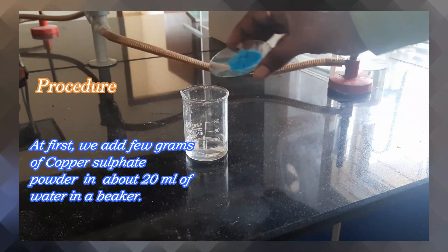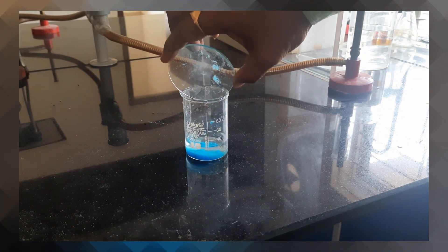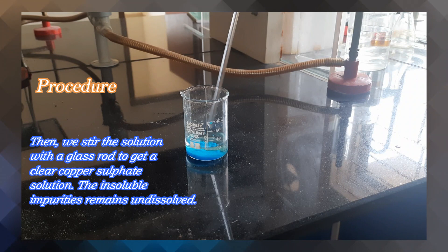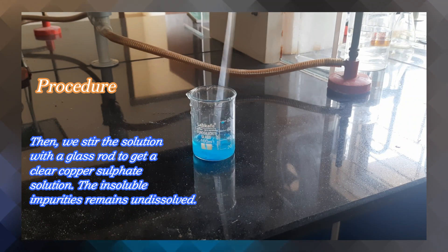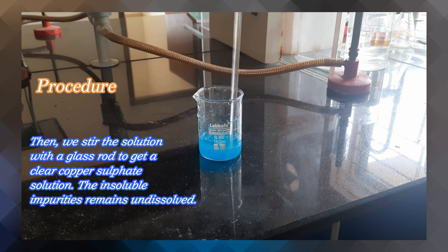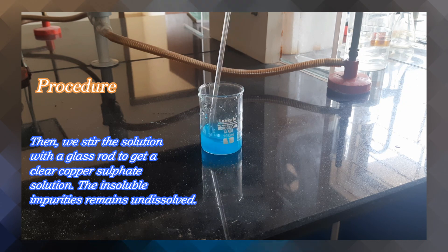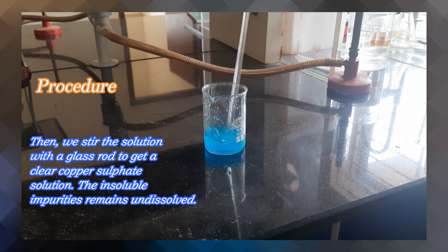At first, we add a few grams of copper sulphate powder in about 20 mL of water in a beaker. Then we stir the solution with a glass rod to get a clear copper sulphate solution. The insoluble impurities remain undissolved.